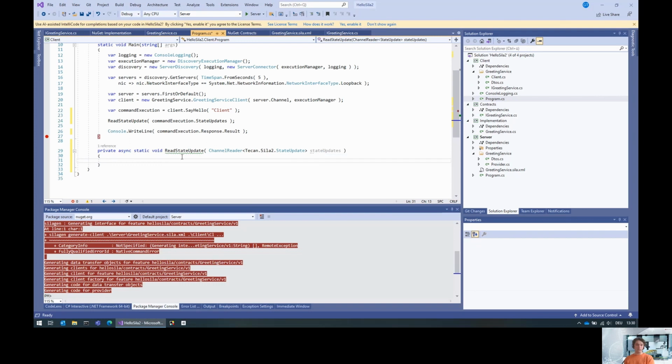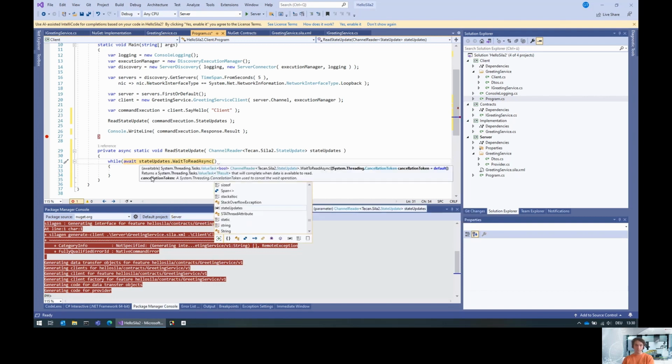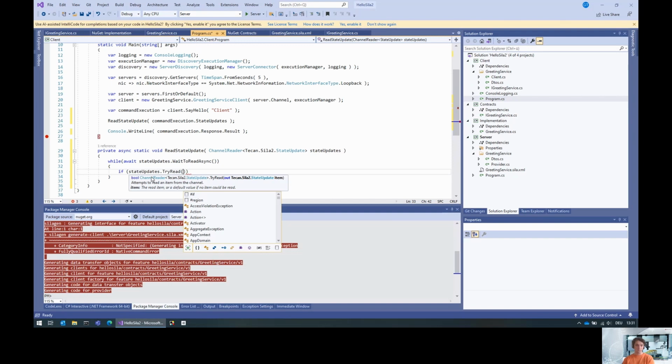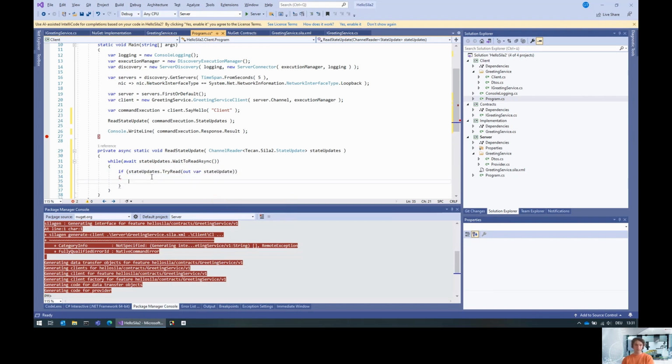And for those of you who don't know how to work with channels, those state updates basically have a completion task, and you can also wait to read async. So what we can do is while await state updates wait to read async, then we try to read a state update.